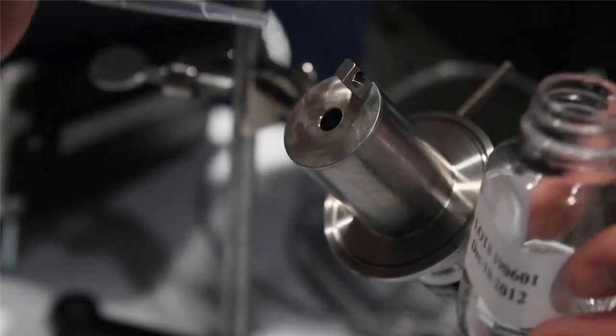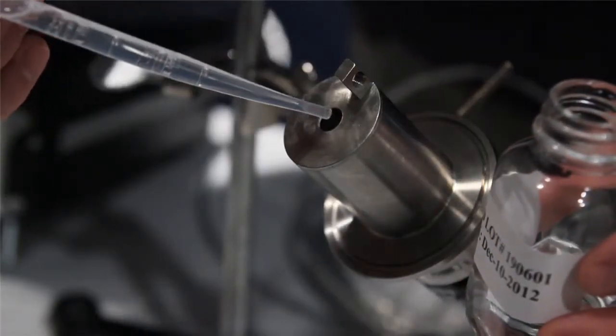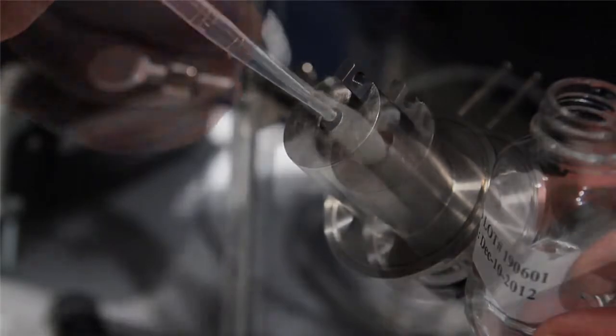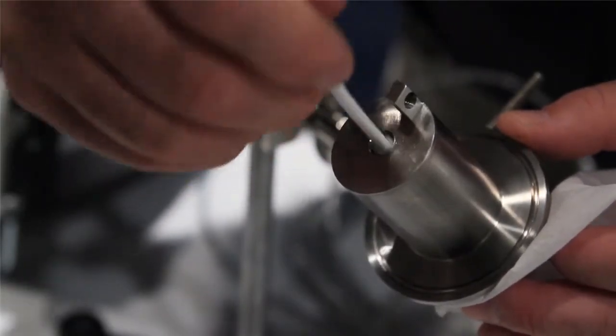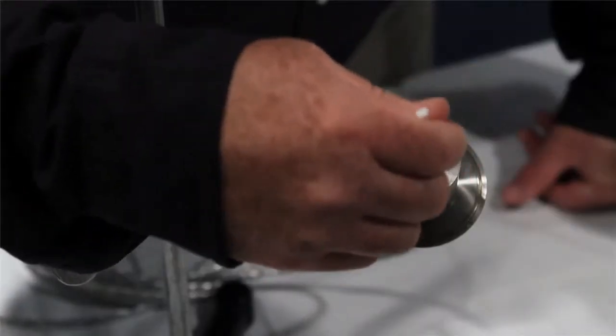Step 1. Pour a small amount of test fluid into the chamber and use a clean foam tip swab to wipe the chamber clean. This helps to remove any solvent from the chamber.